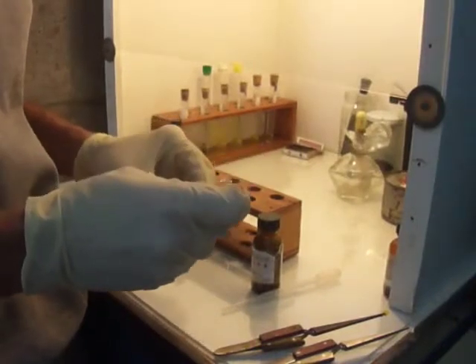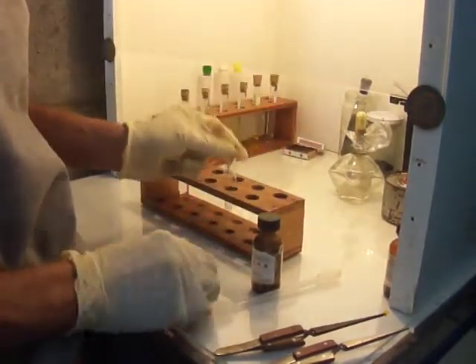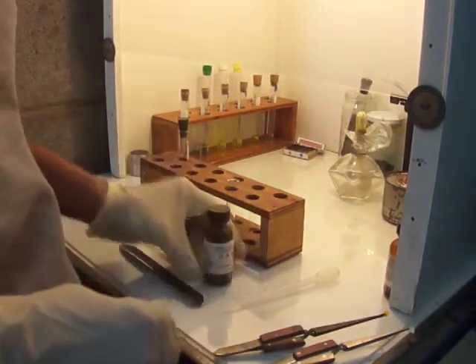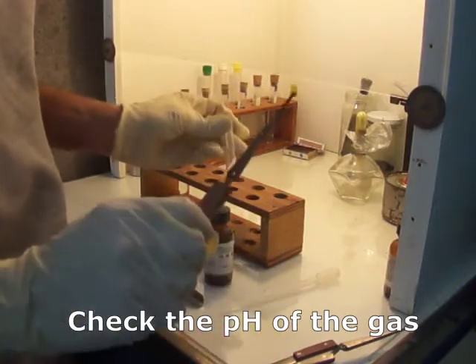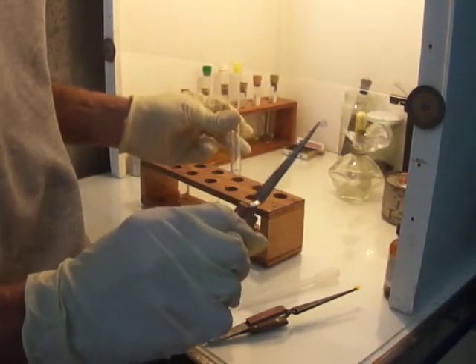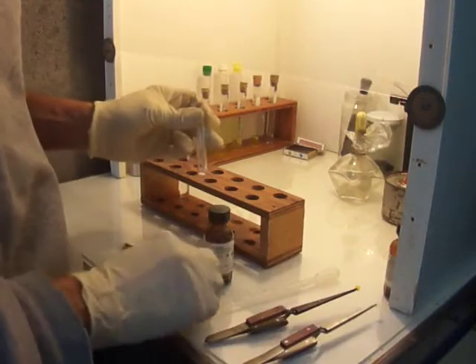So we'll give those a try. First, take about a quarter-size amount, the end of a spatula, of the dry material into a test tube, add a couple drops of concentrated sulfuric acid, and note whether it effervesces. If it does, you can check the pH with wet pH paper, which I have standing by. I also have wet lead acetate paper, which will test for sulfide. It's not part of the procedure, but I did it anyways. And then heat it too and see what kind of gases are given off.